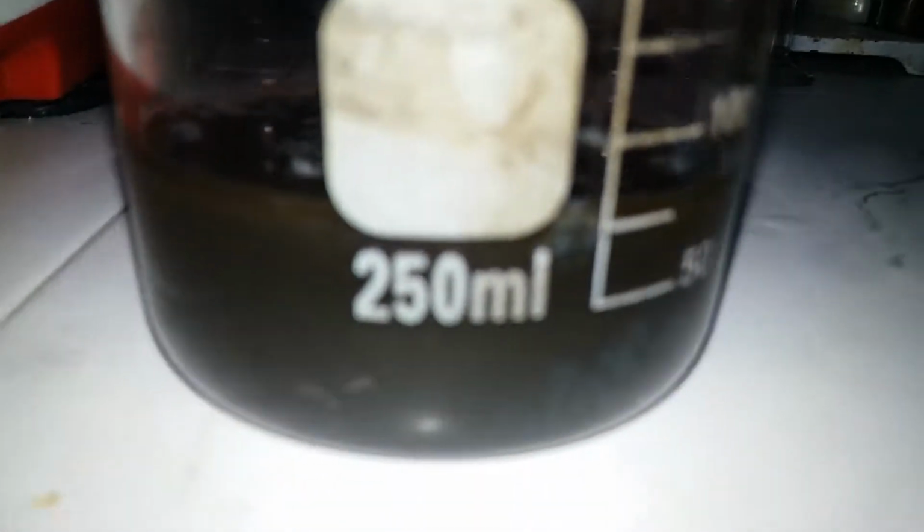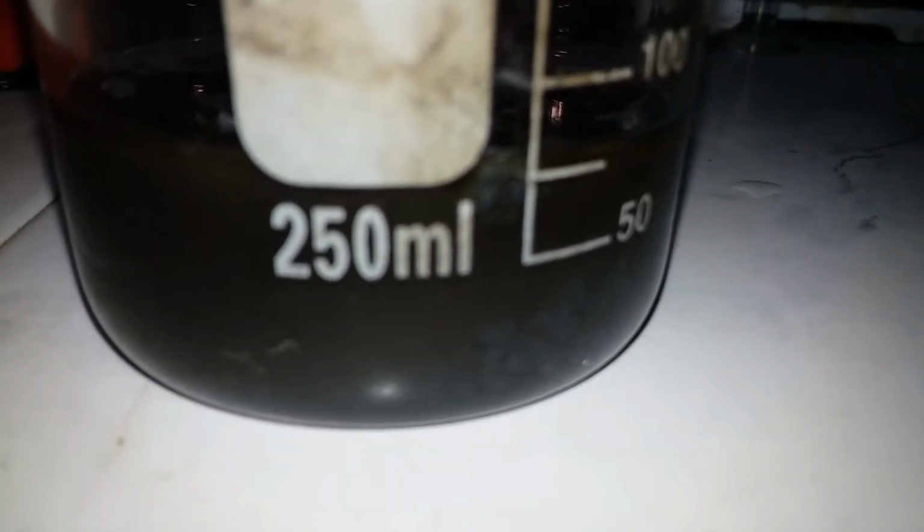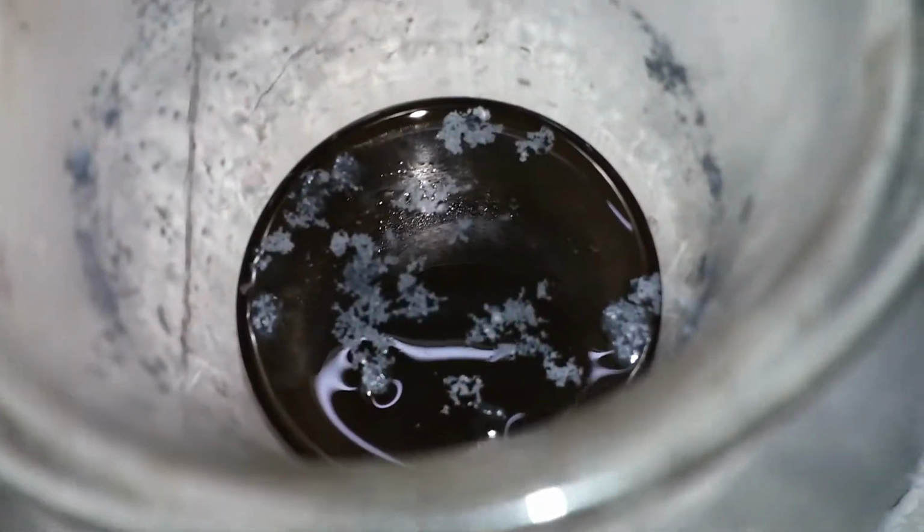So, guess what, guys? Iodine did not precipitate out using hydrogen peroxide. Now, I got so angry, I put them into the freezer and nothing happened. Then I just dumped all my nitric acid in this one. And that gave me iodine precipitation, and it's an exothermic reaction, so, well, some of it just sublimed off.